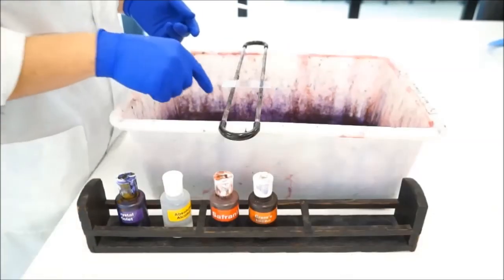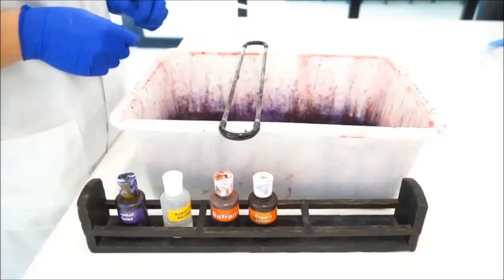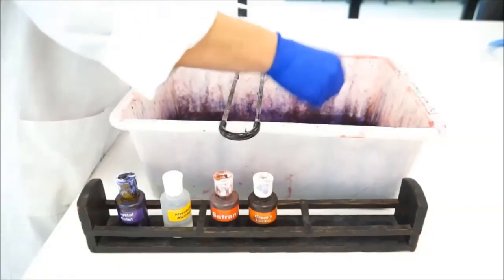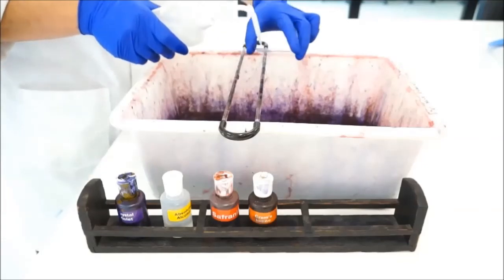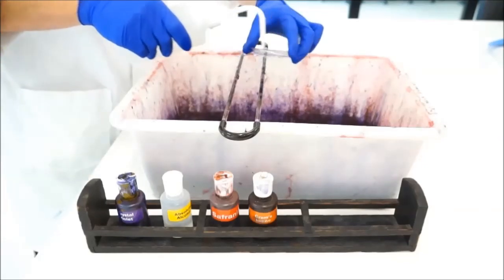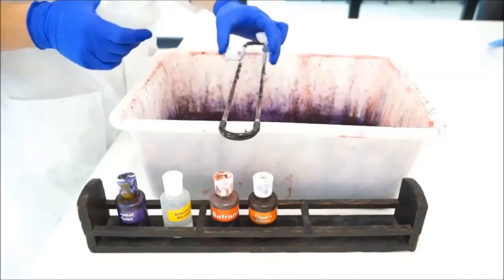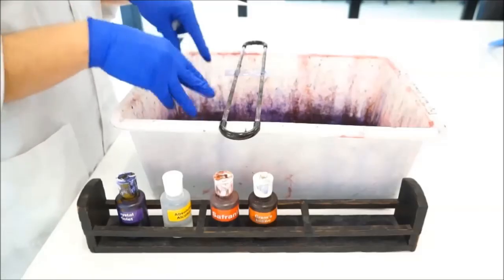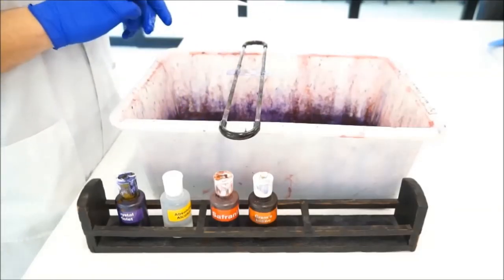If you do accidentally knock your slide into liquid—there's going to be a lot of liquid in there, liquid waste—I'd just get my gloved hand in there and pull it out, give it a quick rinse with your water, and simply keep going with the Gram stain. Because this staining technique is just so robust and so well tolerated that that should still work.